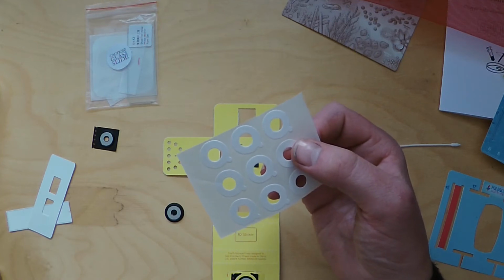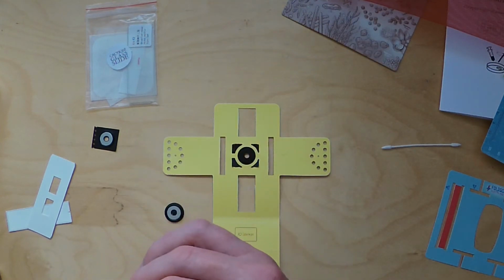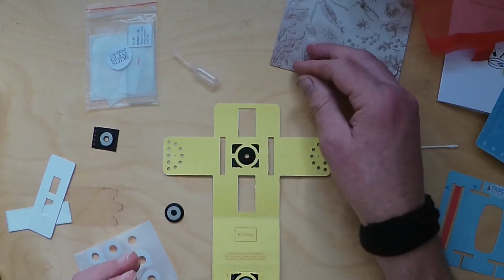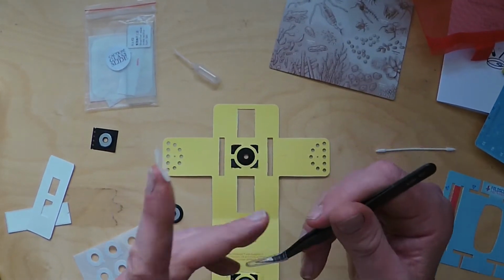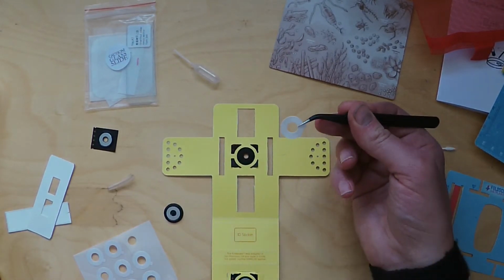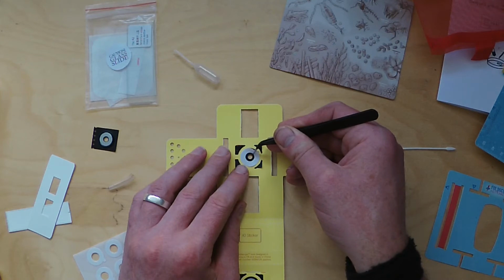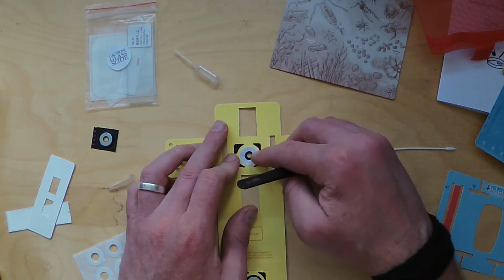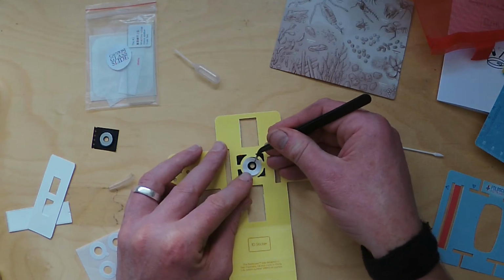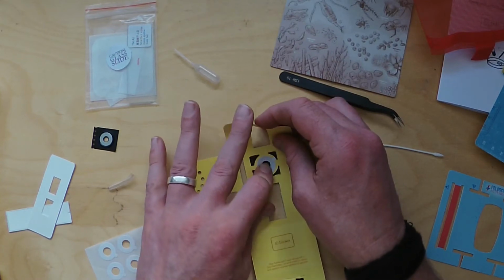So what you need to do is attach a ring sticker up here. You'll see there's a tiny little tab here. Actually, this is where your tweezers will come in handy in the kit. So take your sticker and you want to stick that as centrally as you can over there, like that. I'm actually going to take it off, put it on again. The stickiness just helps to kind of secure it in place.